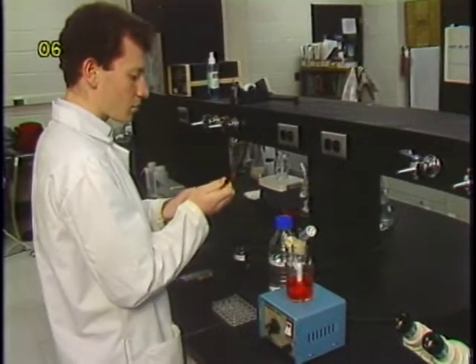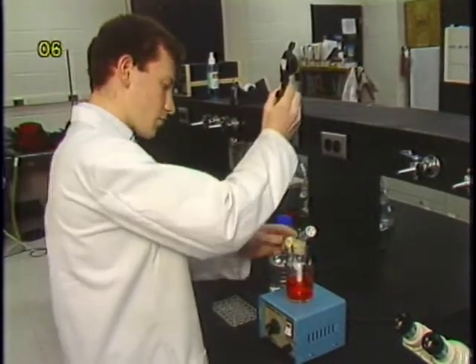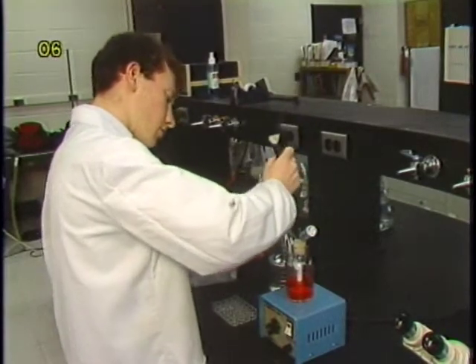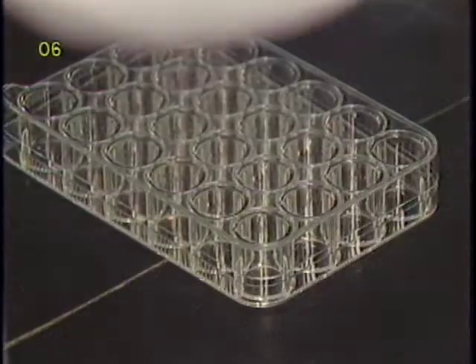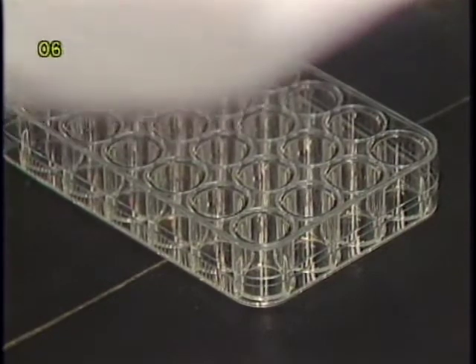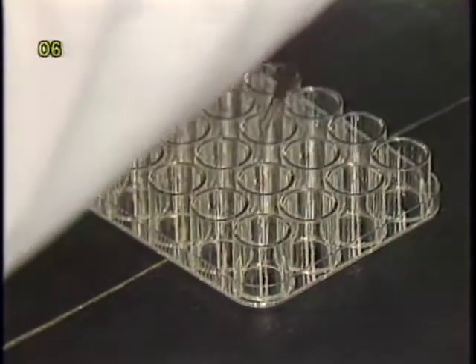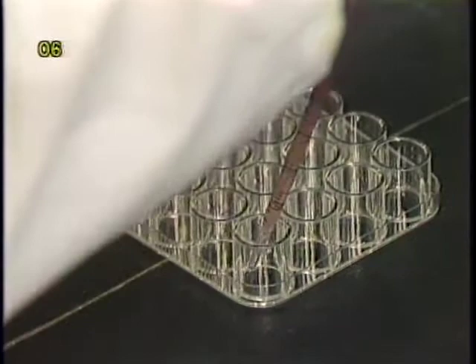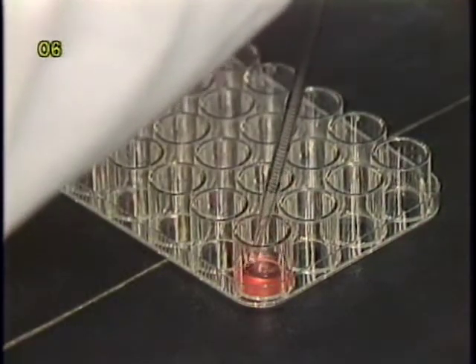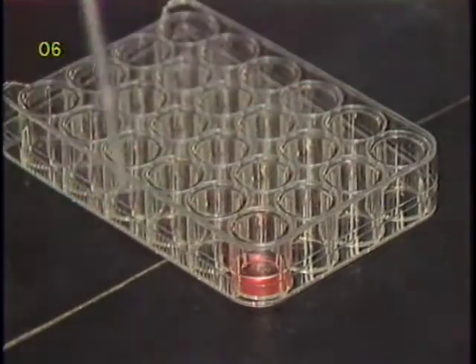To observe cell attachment, 0.2 to 0.4 milliliters of cell and microcarrier suspension is withdrawn from the spinner and transferred into a 24-well plate. When taking the sample and transferring it, it is necessary to keep the pipette in a vertical position so that no microcarriers are retained in the pipette.